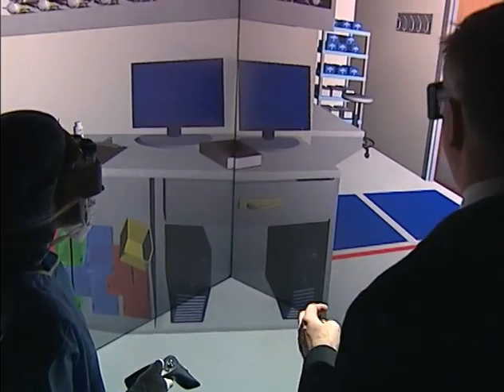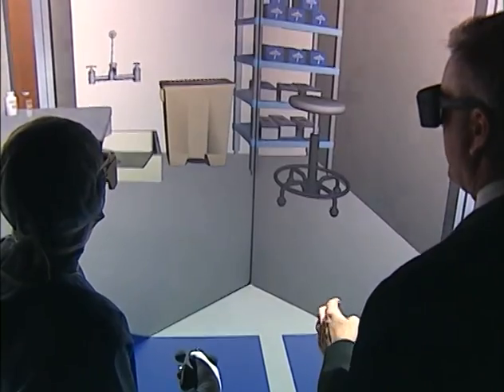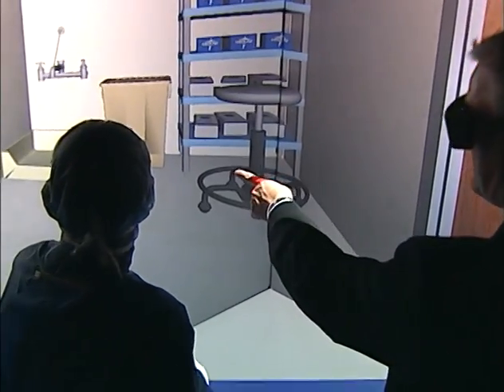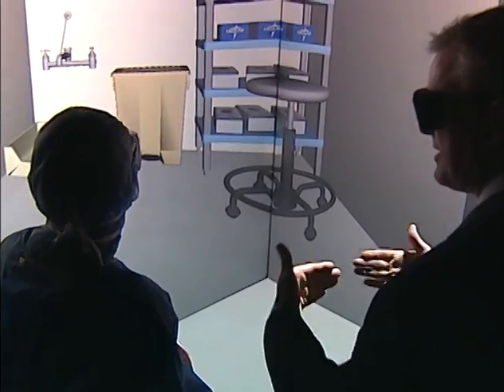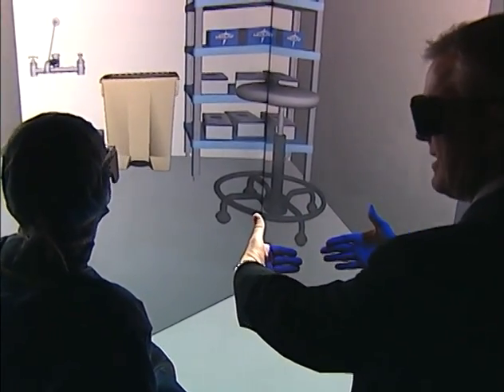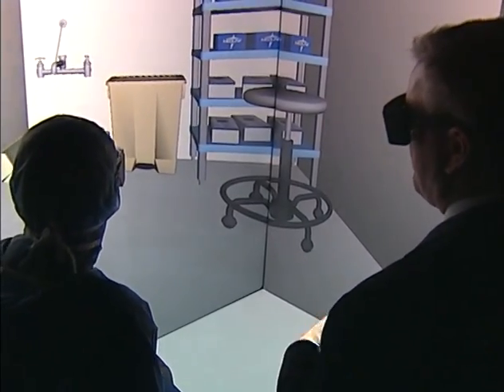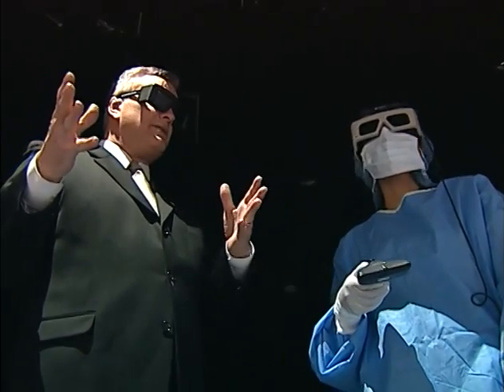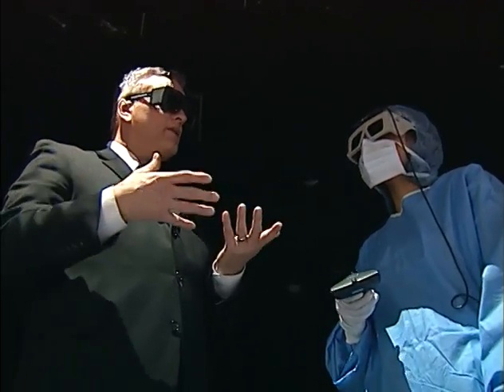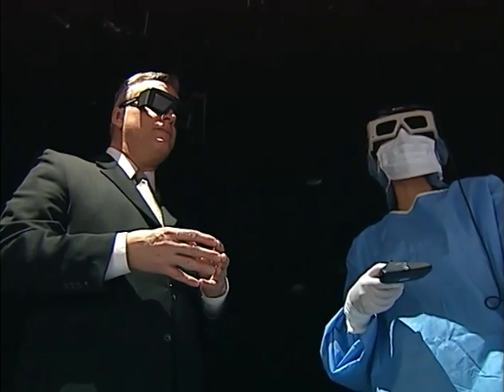And then if you can swing around this way a little bit, I'm going to show you something. We're actually going to remove this from our room, but we have this sink because historically it had been common to have sort of a mop sink that was back within the area of the clean room that's supposed to be the most sterile. Within the clean room, there's at least four things, actually probably a few more, that I would like you to look for that seem unusual or maybe inappropriate to you.